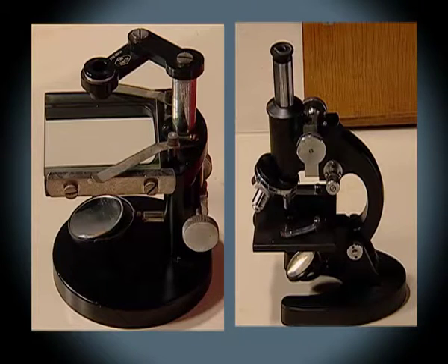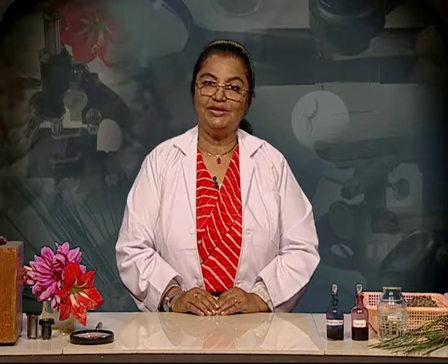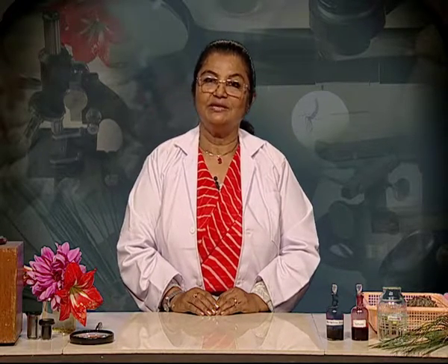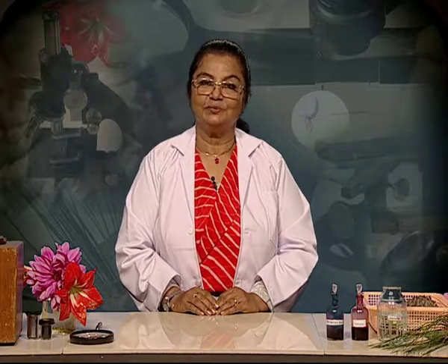So, dear friends, we have seen that there is a vast world of things to see and learn about with the aid of microscopes. I am sure that today the mystery surrounding the microscopes has been solved, and also that you have gained mastery on how to use a microscope. Thank you.